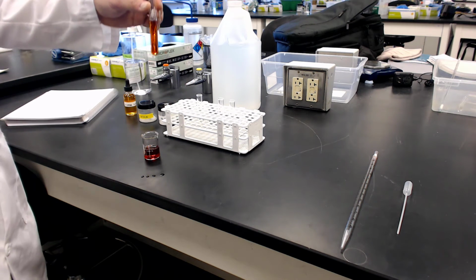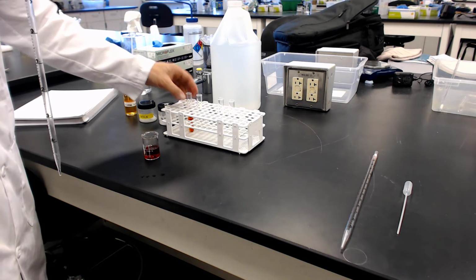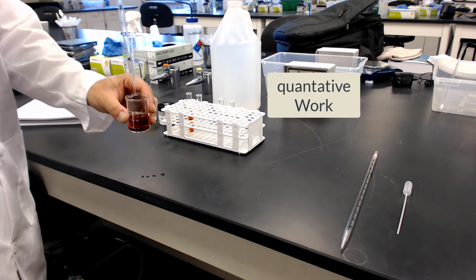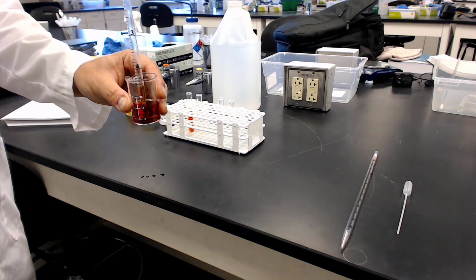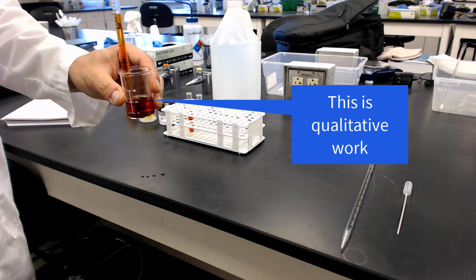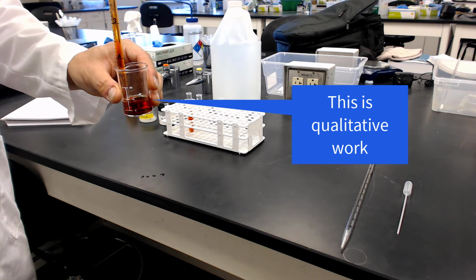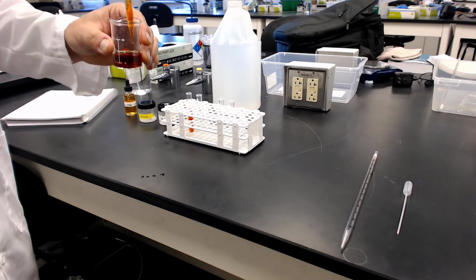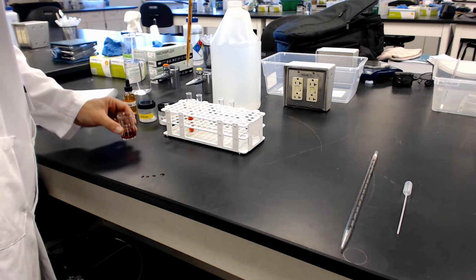You would not dispense out of the tube till it's completely empty, but he's just basically trying to get roughly 5 mils in. So he's going up to the 5 mil mark and then dispensing out past the tip. And that's okay for this sort of less quantitative type work. We're just going to be doing this equilibrium shifting.